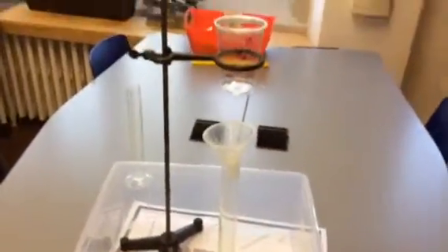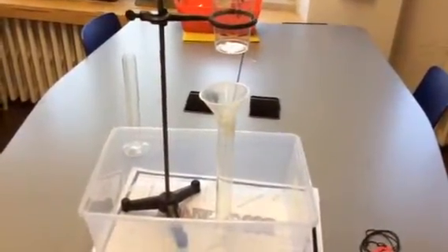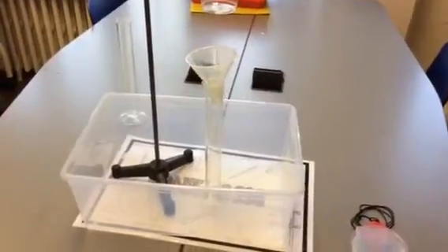So as you can see here now, I've got the special pouring cup set up in the ring that's attached to the retort stand. You can see they have a 100 milliliter graduated cylinder and then a funnel. And the funnel's there just because sometimes the oil kind of walks around as it drains out. You want to make sure it all goes into the graduated cylinder. But the key move here is that every trial that everybody does is going to be until we get to the 50 milliliter mark, okay? So I'm not sure if that's visible here in the video, but there's 50 milliliters right there. So that's why it doesn't matter. You don't have to be exact with how much oil is in the container or how much you measure.